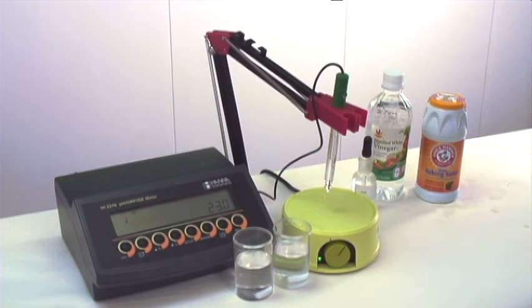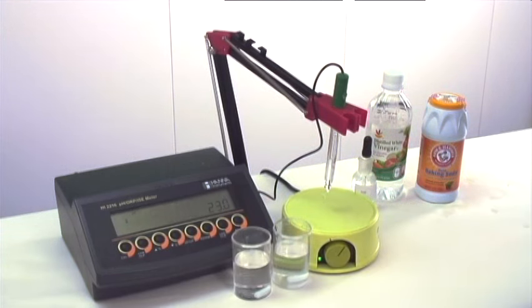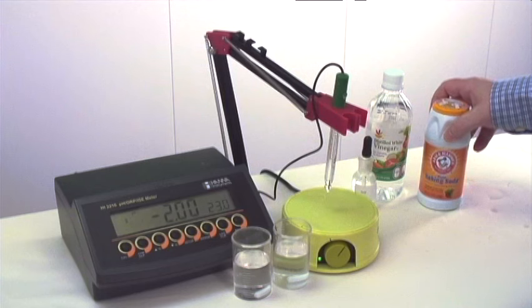For this demonstration, we've prepared two beakers. The beaker on the left contains deionized water, and the beaker on the right contains deionized water with baking soda, or sodium bicarbonate.